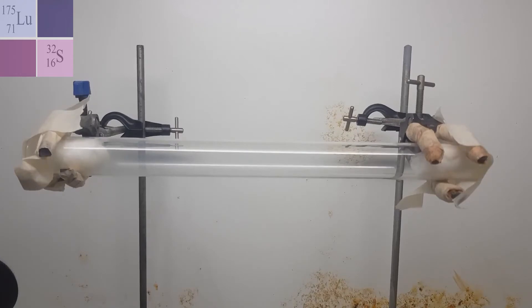Now if the concentration isn't high enough I may not be able to see it but I saw more or less the concentration of white was here initially and the rest was clear and now it's starting to get cloudy, which means that there wasn't enough to form that clearly defined white ring that we are looking for. And of course based on the explanation for diffusion both particles are going to distribute themselves within the glass tube until both of them are evenly distributed. So eventually the whole tube will develop a cloudy appearance.